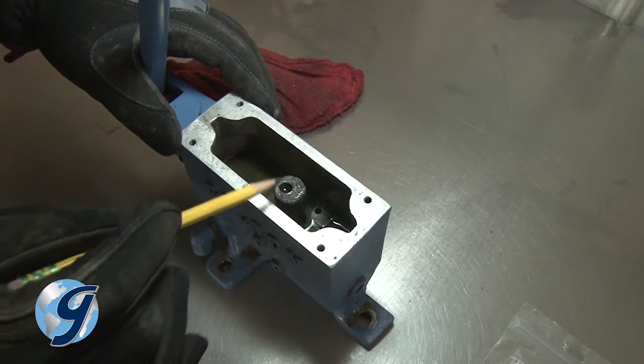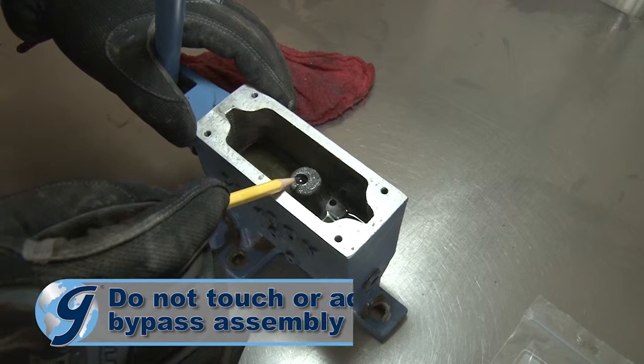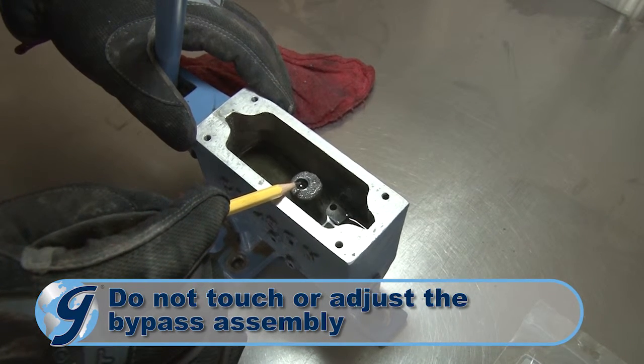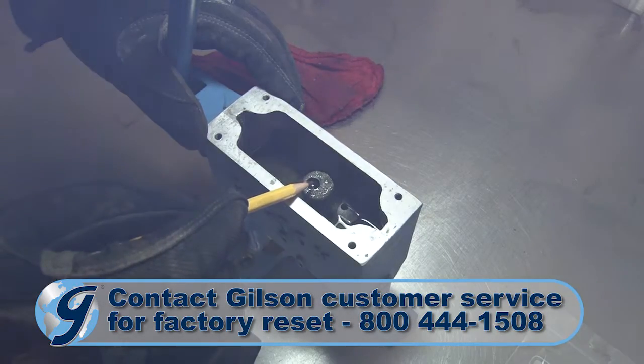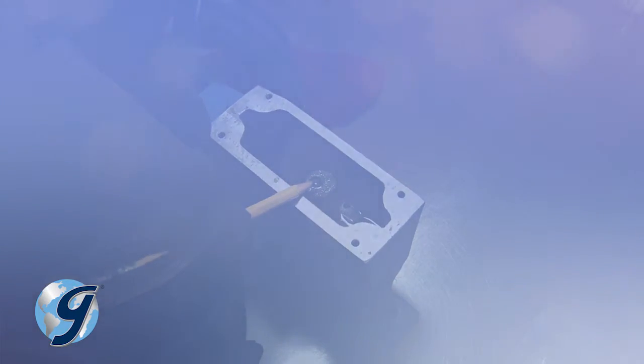It's important that you do not touch the bypass assembly. This is set at the factory using special fixtures and should not be changed or adjusted in the field. If you accidentally remove or adjust the bypass assembly, please contact Gilson Customer Service for instructions on how to return the pump to the factory for a reset of the bypass assembly.